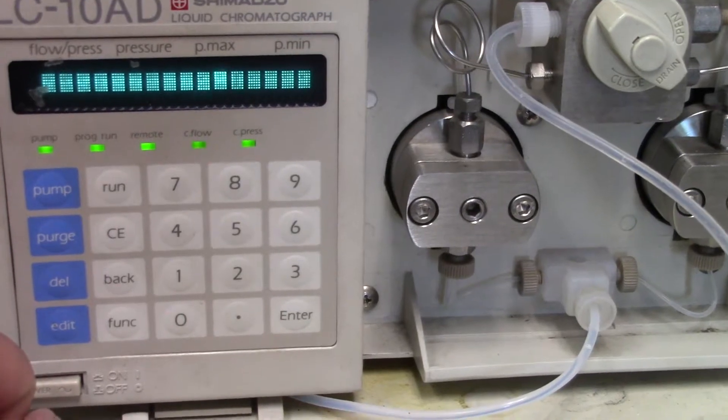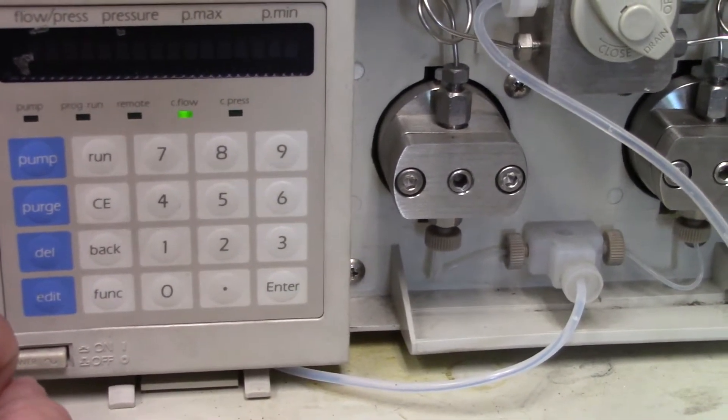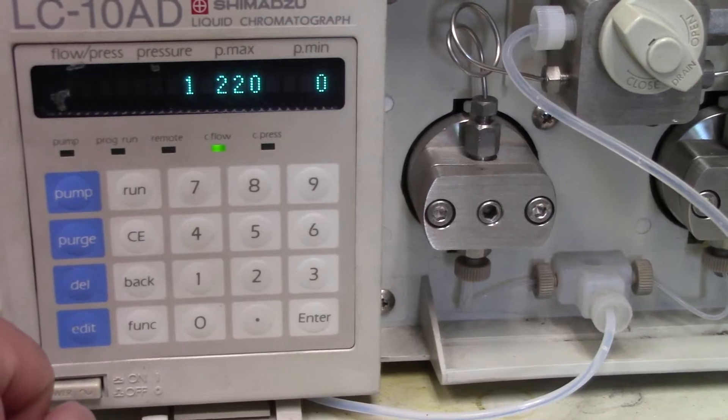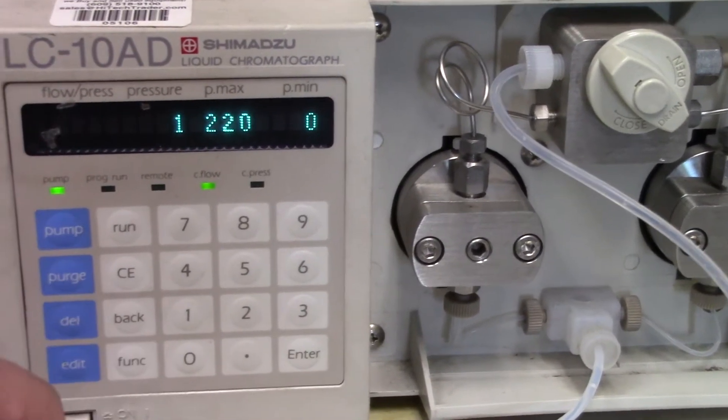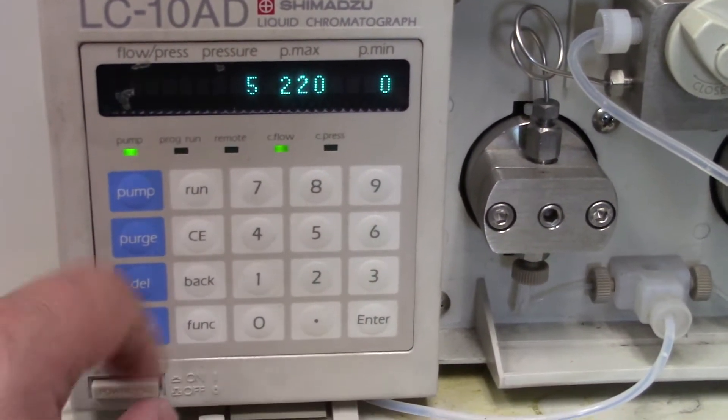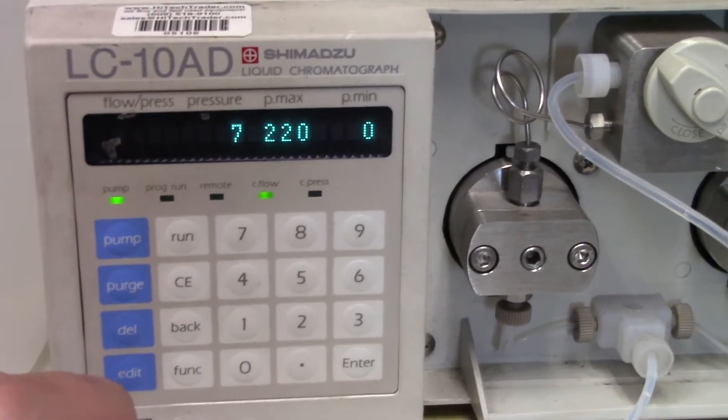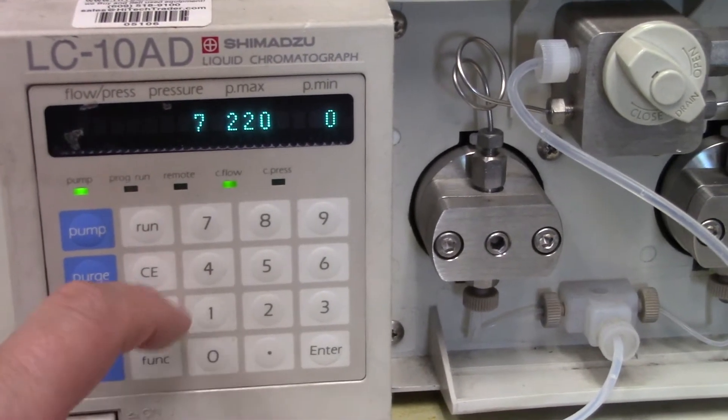Power's on, self-test. On, off. Pumping pressure. And then we'll go.